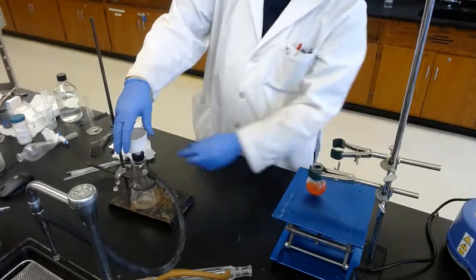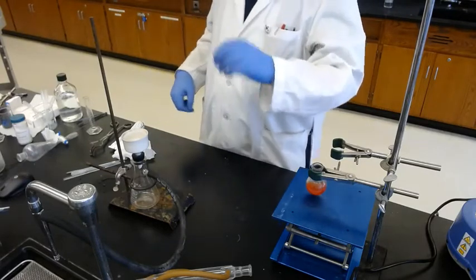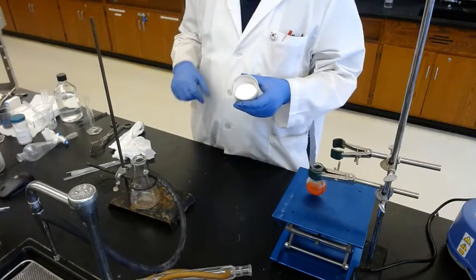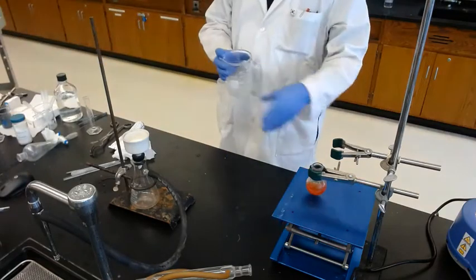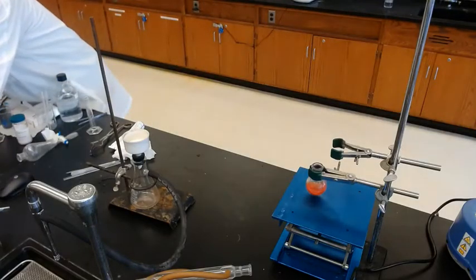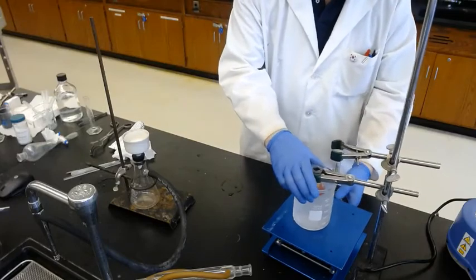Set up the Büchner funnel and make sure the size is correct. If the black rubber adapter goes all the way in, that's not the right size — about halfway, no more than two-thirds, should go inside. For vacuum filtration you need a specific size of filter paper matching the Büchner funnel — it should not be bigger and it should not be smaller. Before filtering, cool the solution in an ice bath because we want more solid to come out.